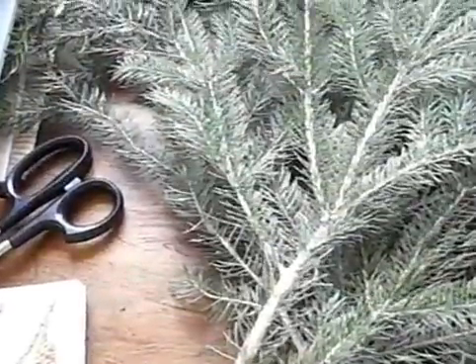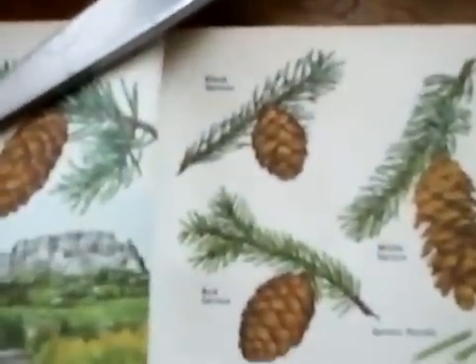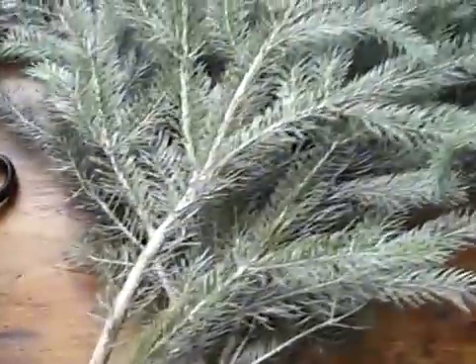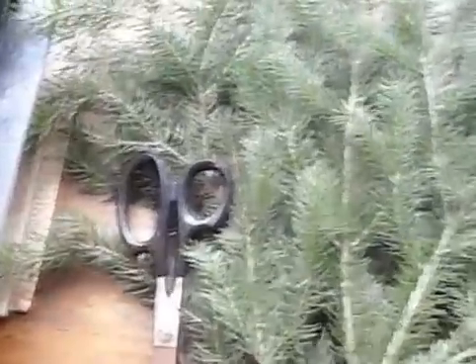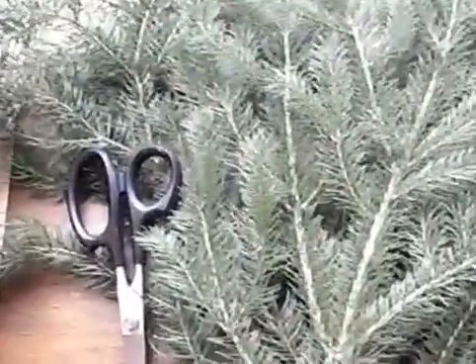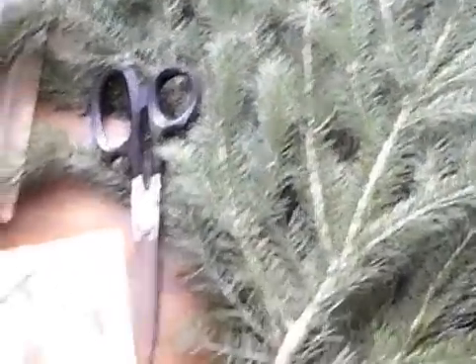I have here some spruce — not really sure if it's black or red, it looks green to me, very funny. This is a wild native species and I'm about to cut it up into one-inch pieces and put it in the two-liter bio flask to steam distill the essential oils.